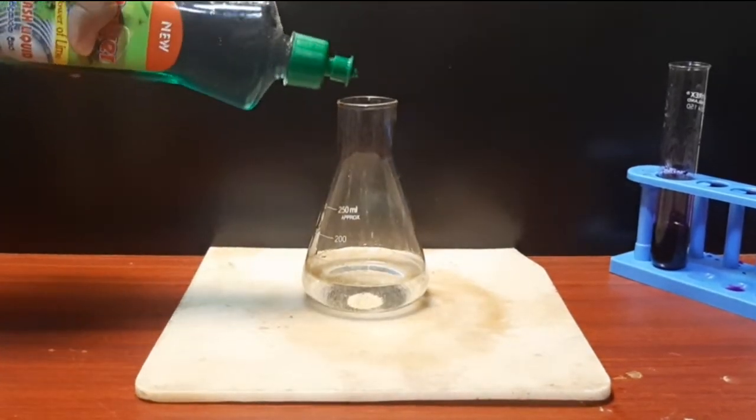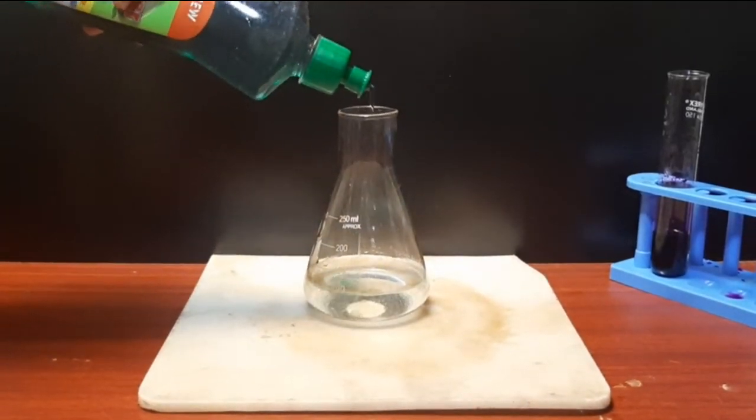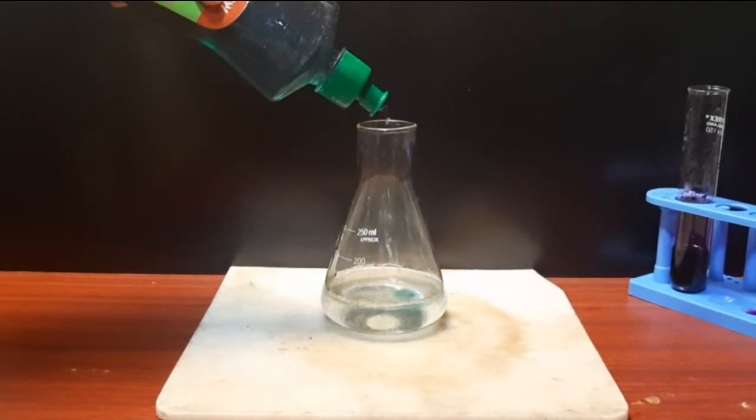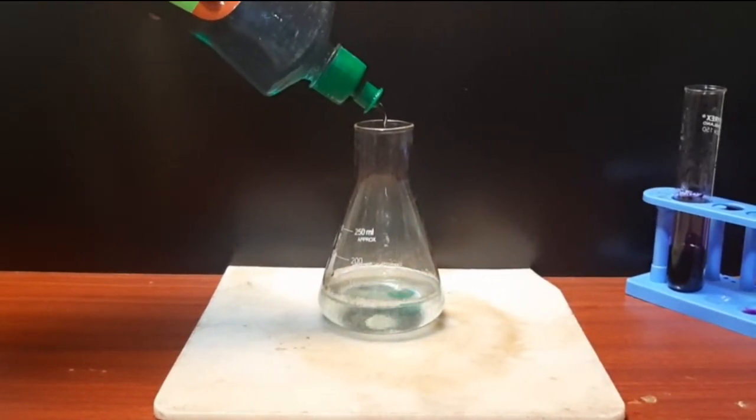Next, we add some liquid detergent. The foam in the reaction is produced by the detergent.